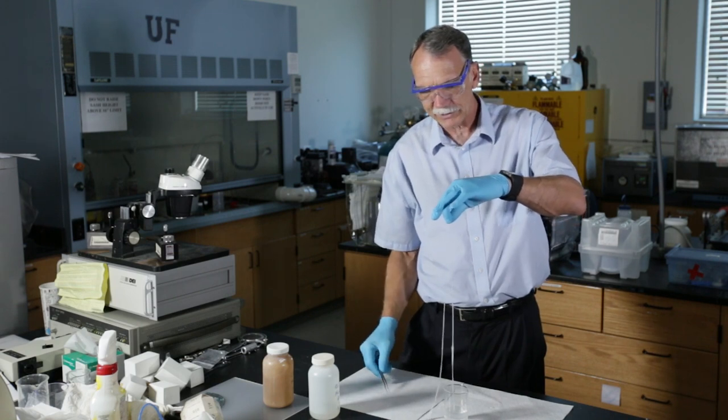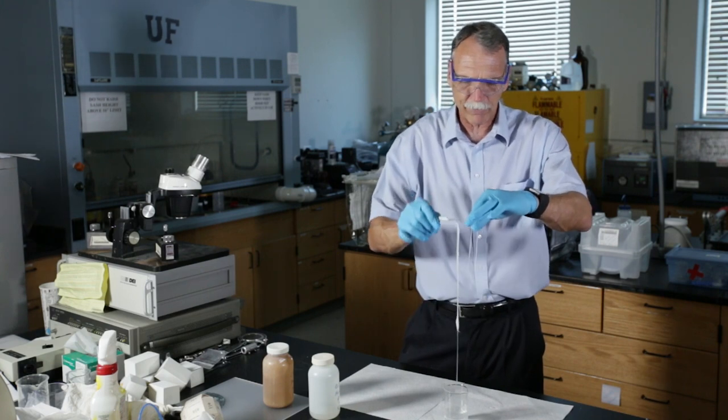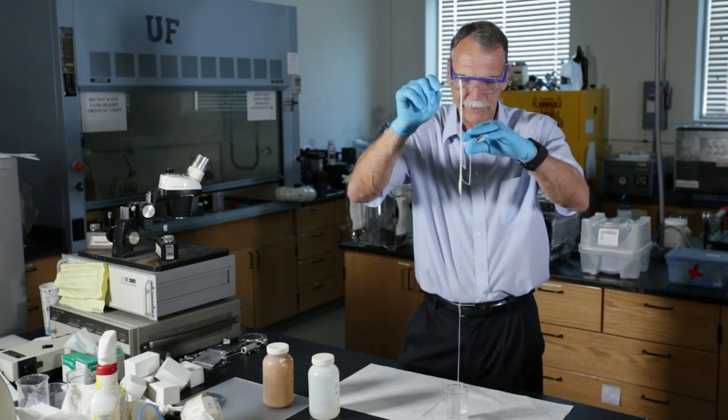Now, obviously, commercially, you're not going to sit there and try to pull out strands of nylon, but it's a very nice way of showing you how polymerization can occur at an interface.